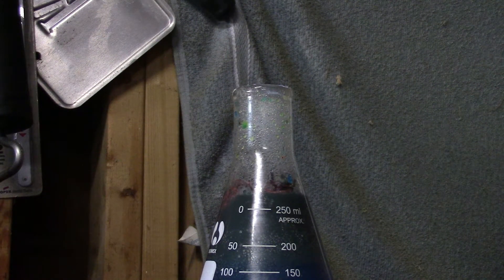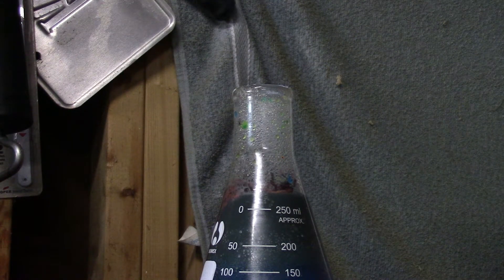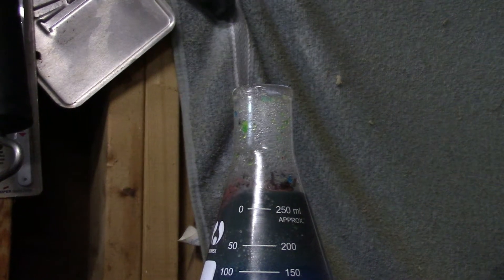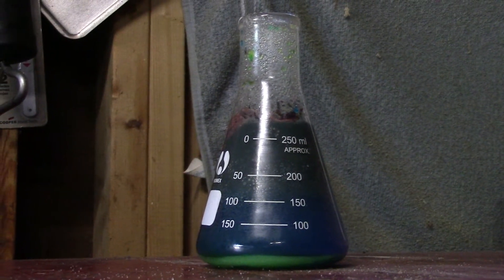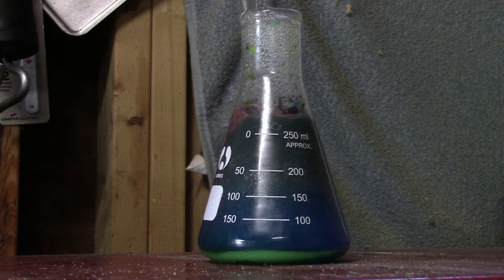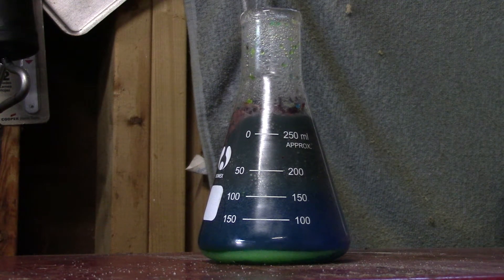As you can see, the hydrogen gas is bubbling away and the reaction has heated up to boiling temperatures — you can see water vapor condensed on the sides of the flask and steam coming out of the top because of the increased rate of reaction from being catalyzed with that sodium chloride. This is a single displacement reaction between aluminum and copper sulfate, giving aluminum sulfate and copper metal that precipitates out of solution. The overall reaction will take about an hour to an hour and a half, so we'll speed this up and look at the end product.